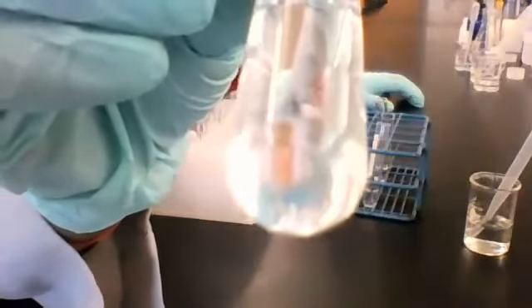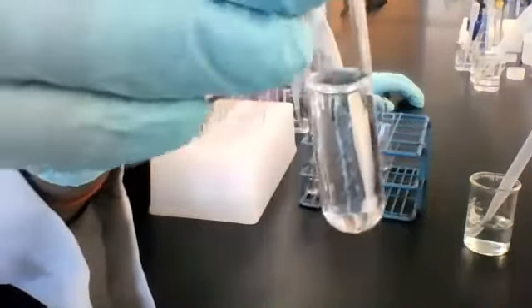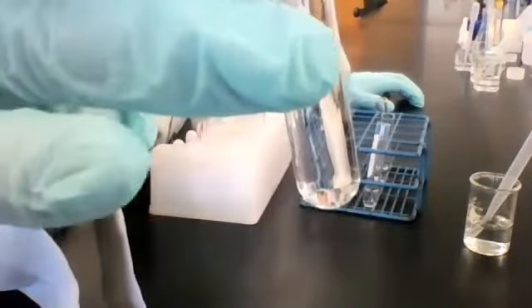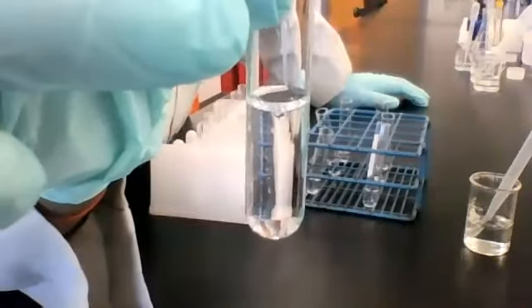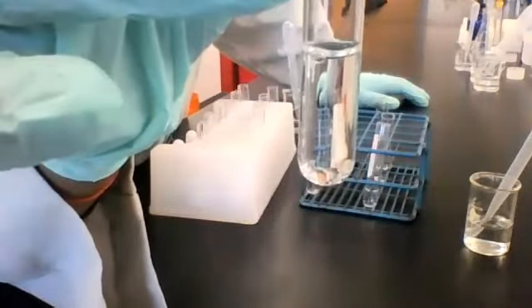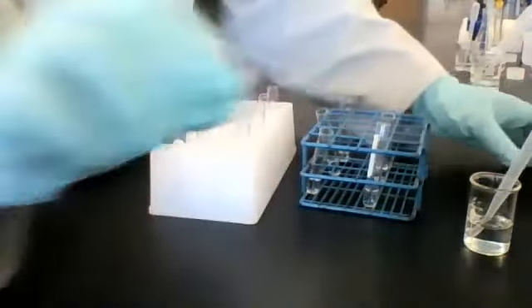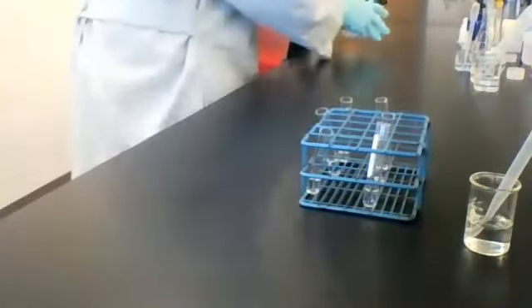There's nothing there. I don't see anything. I don't know if y'all can see this bubble here, but it was already there, so don't pay it any mind. All right. So we've done the first and second rows.